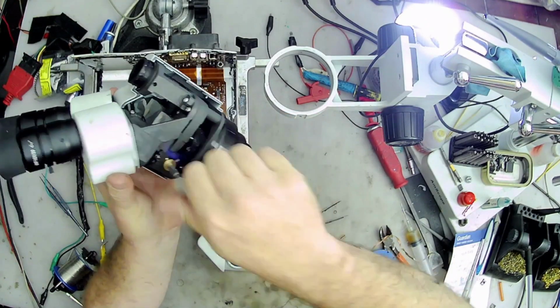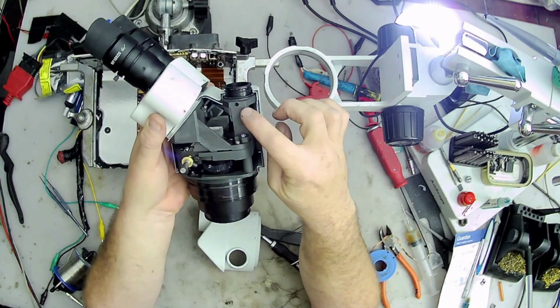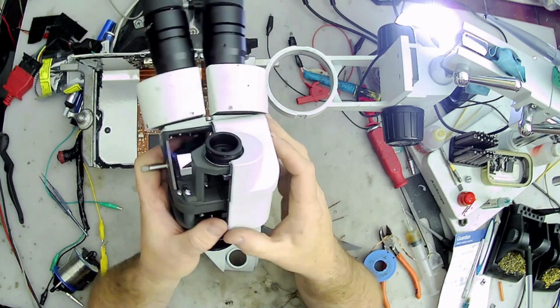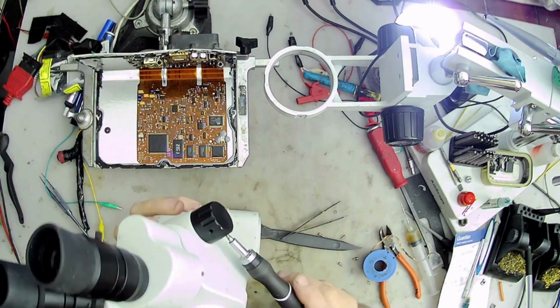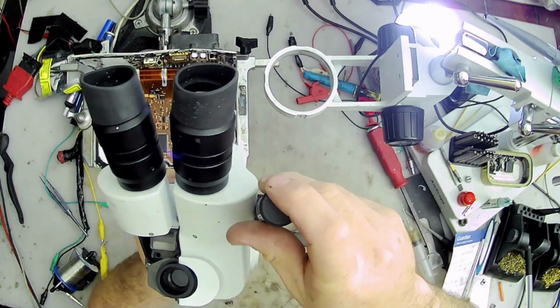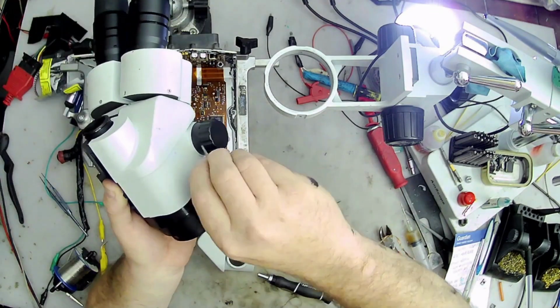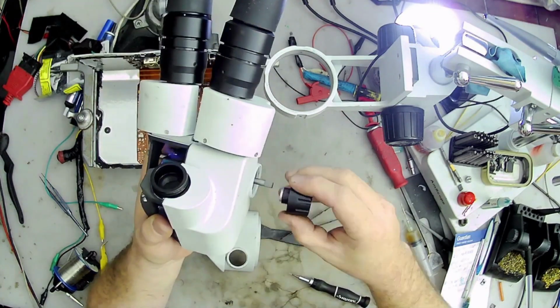We can see the inside. We can see some of the gears for the magnification, and there we can see a hole for a set screw. So the lens is held in place by a set screw. The third eye there, I was trying to be lazy and not take that handle off, but I did have to take it off to remove both sides of the case.